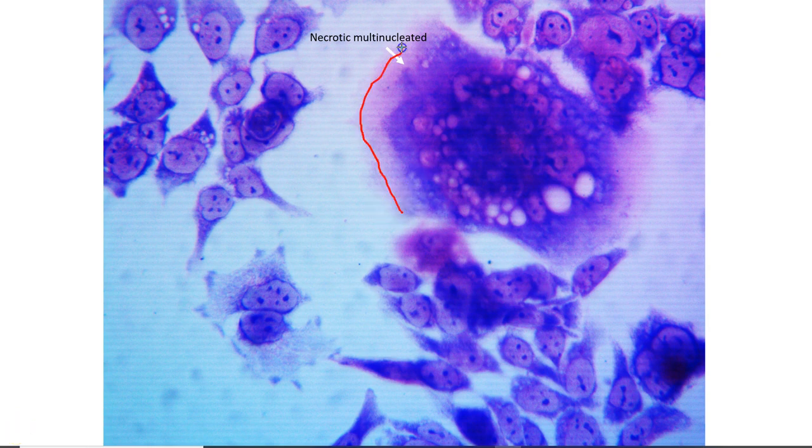That is a humongous cell compared to all the other cells that you see in that culture. So this would be one of those exaggerated examples where you see lots of nuclei completely getting hammered and destroyed inside, lots of vacuoles forming, and the membrane getting larger and larger as it gets ready to explode. In the same culture, this seems like a very aggressive culture. You see some cells that would qualify as typical cells still, right?